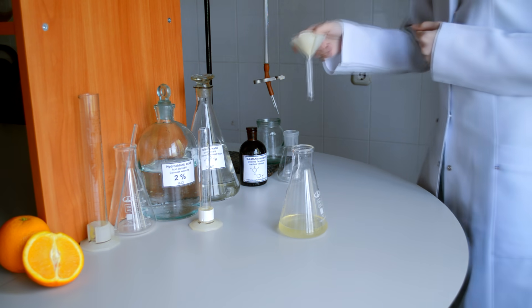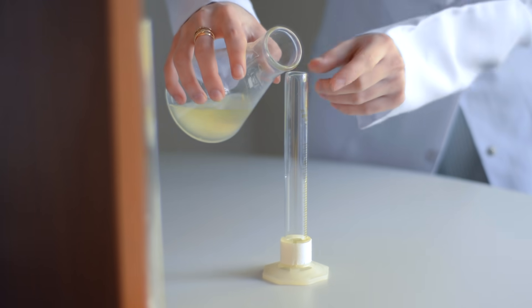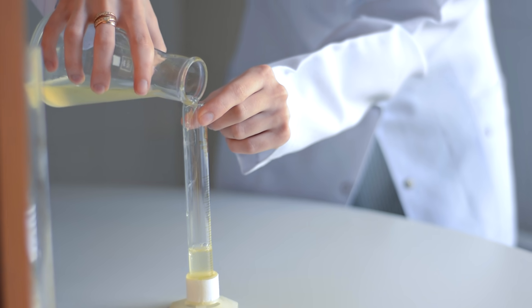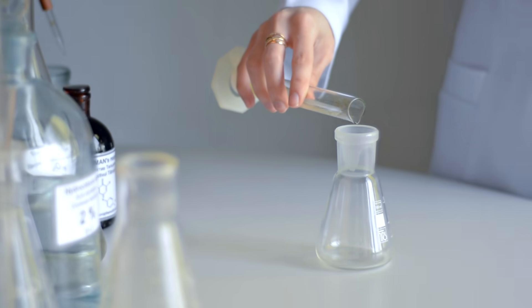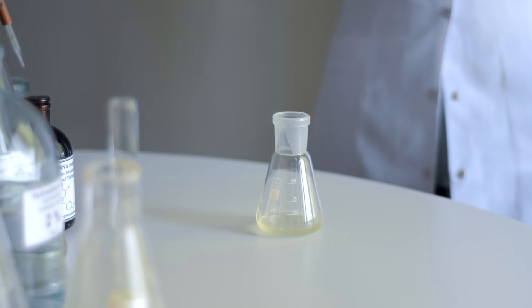The preparation is nearly done, but we need only 10 milliliters of the solution, so we pour it into a graduated cylinder and then into a conical flask so we can use it for titration with Tillman's reagent. For titration we will use Tillman's reagent and we will titrate it until it reaches the pale pink color.